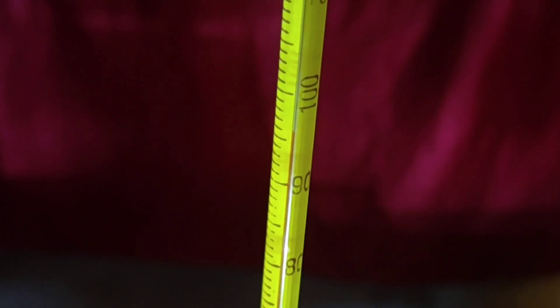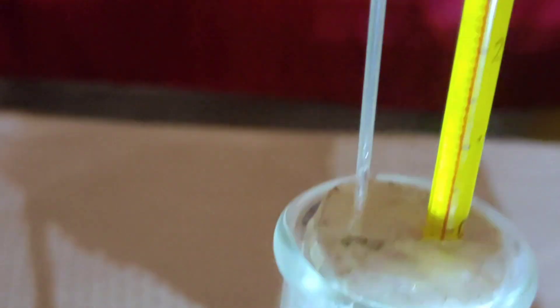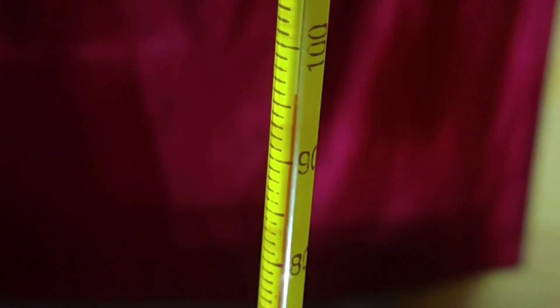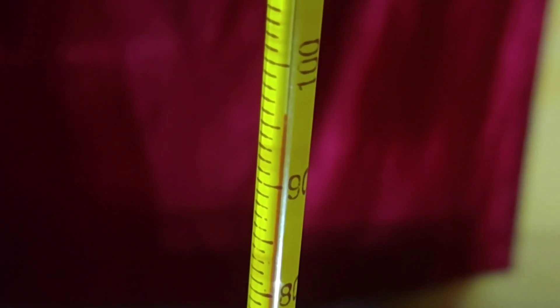Record the temperature when you observe a steady stream of bubbles. This is the boiling point of water. Do you observe any further rise in temperature? No.